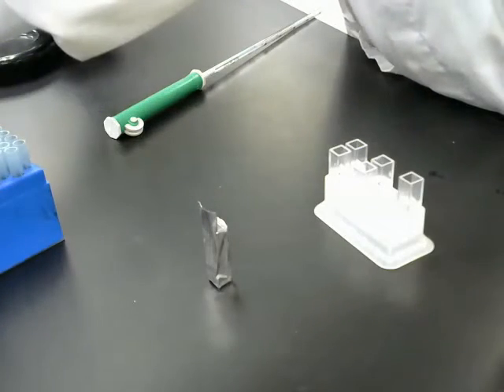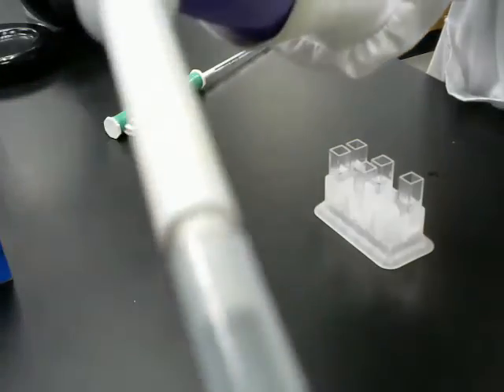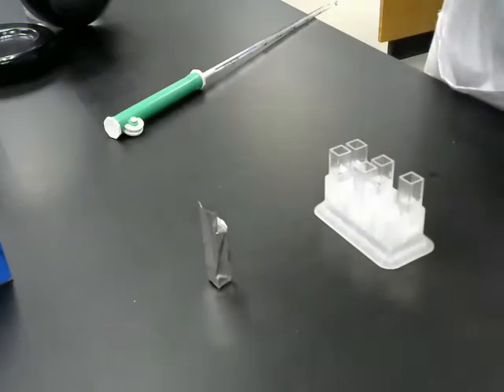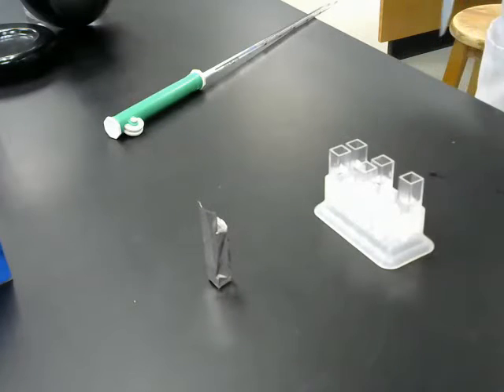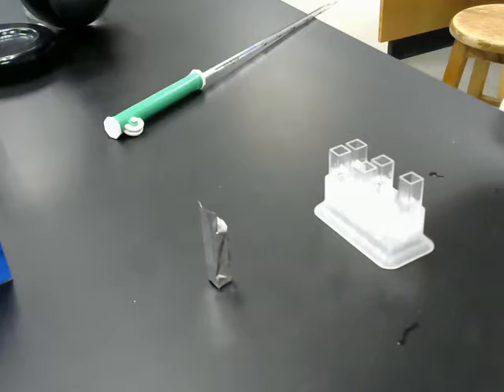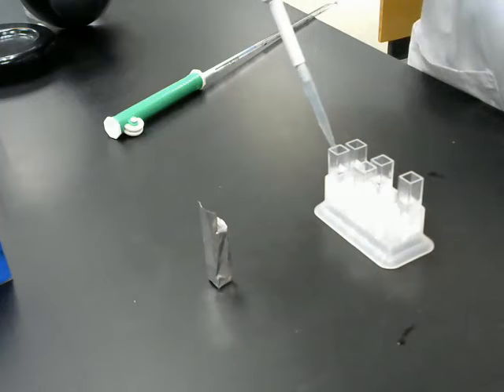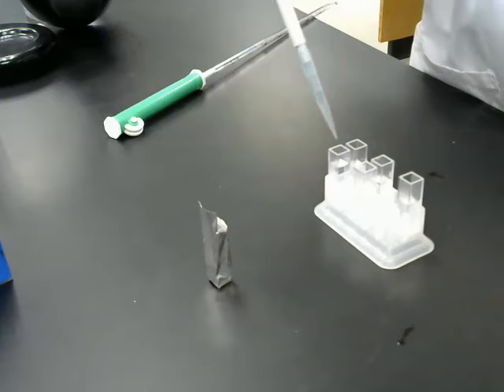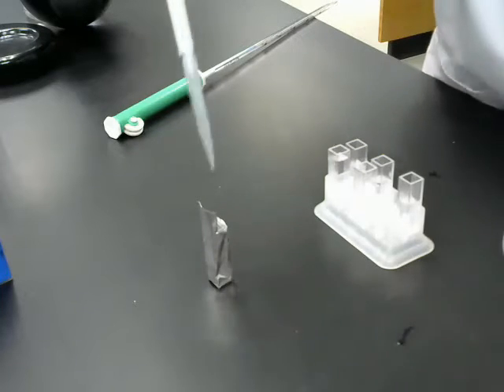water. So I've set my pipetter to 0.5 mils, or 500 microliters, and in my control I'm going to give it 2 half mils to take it up to 1 milliliter. That replaces the volume of the DPIP that I'm not going to add to my control. So that one gets 2. Every other one gets just 1/2 mil.